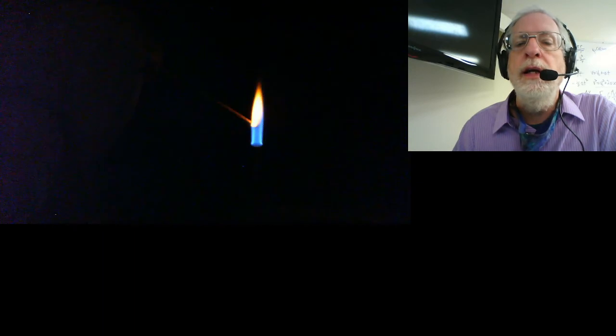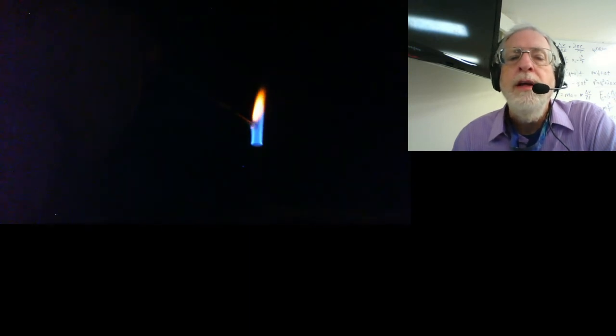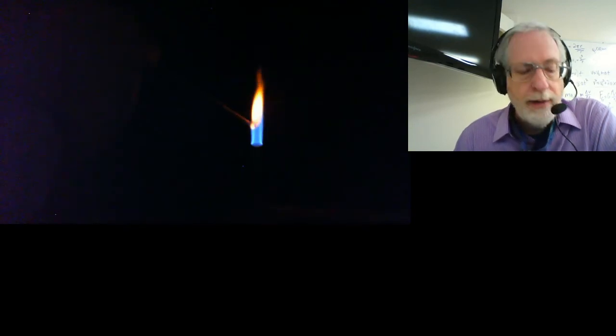And I may not even need to pause this one because I get a really good reaction here. Right about there, you can kind of get a good color of it. Good images. It almost gets washed out. So look at the tip of the flame. If you look just at kind of like the tip, because it's getting kind of washed out and appearing more white, it's not really white. Look at the color towards the top there. That's the color that we're looking for, strontium chloride.